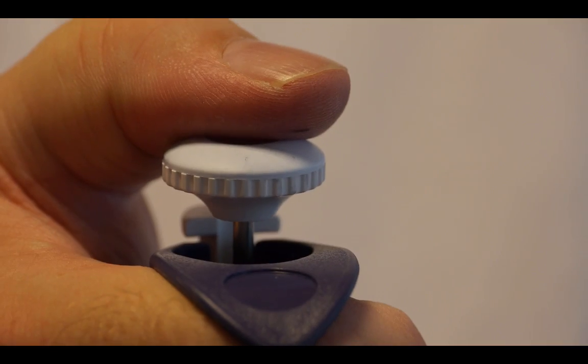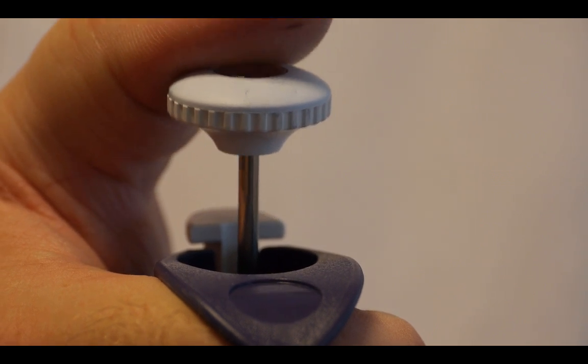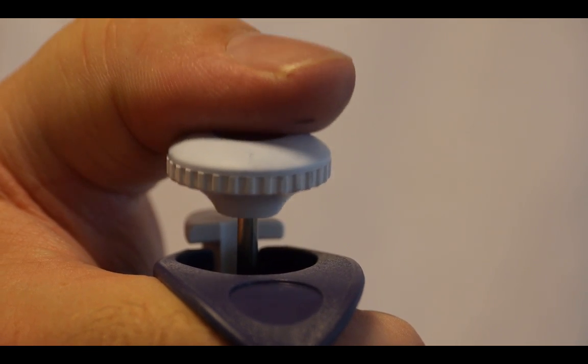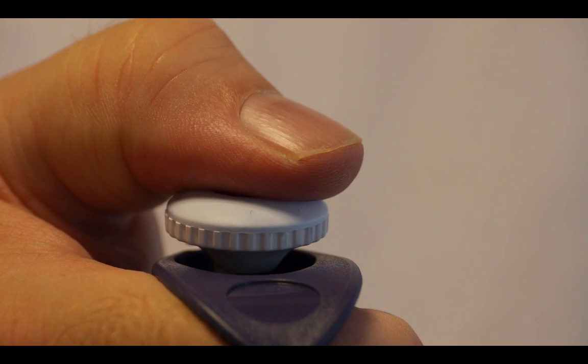So, push down to the first stop, put the tip in the liquid and then bring your thumb up. Push down to expel the liquid and then push all the way down to remove excess.